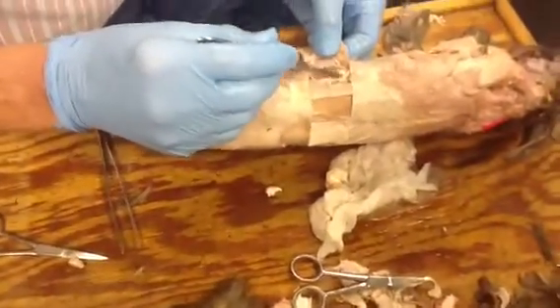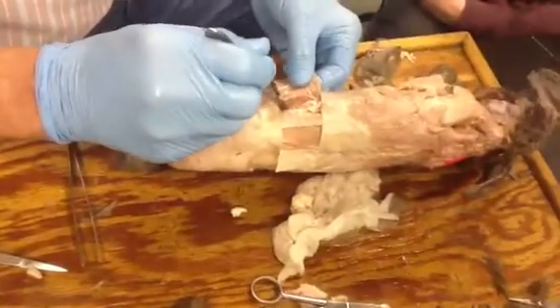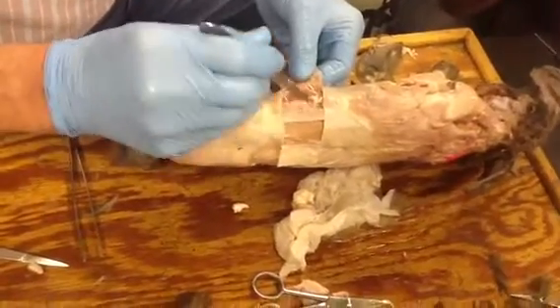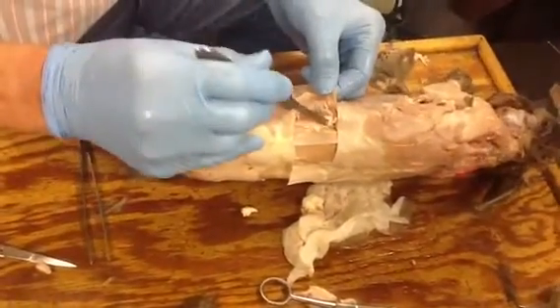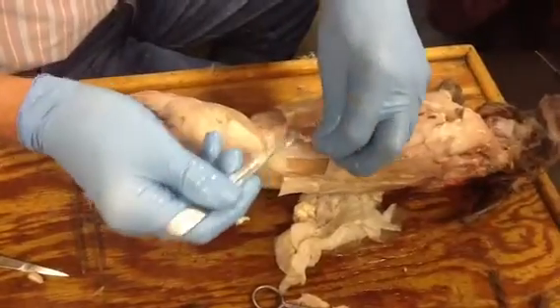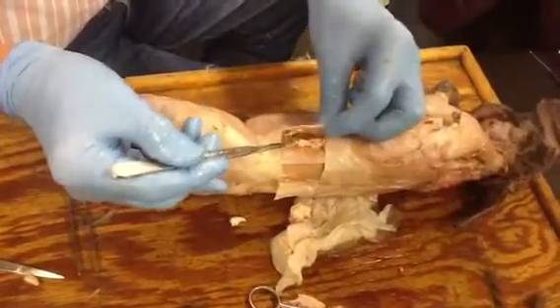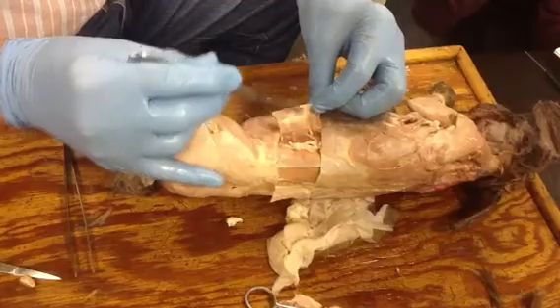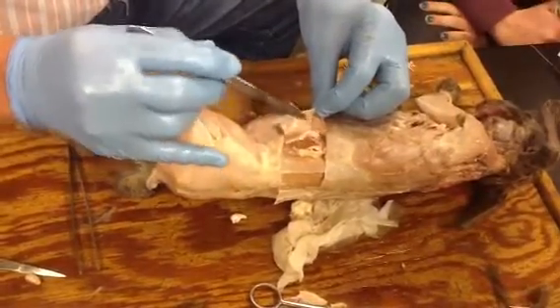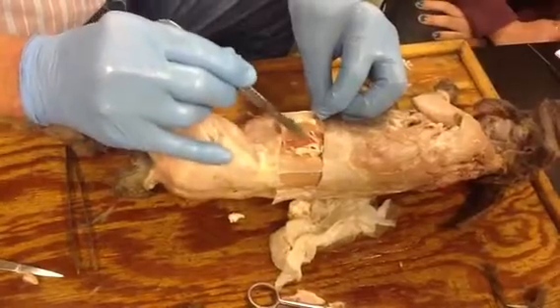Do a nice job on the dissection because you're going to be tested on these. To the best of my knowledge and opinion, we've got external oblique, internal oblique, and transverse abdominus.